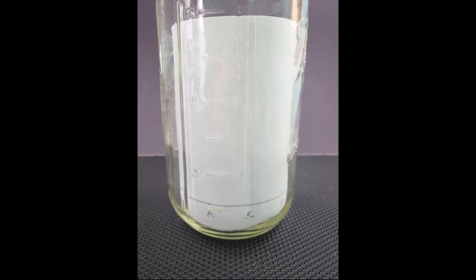Place the tube into the solvent mixture in the chromatography jar. Make sure that your pencil line is just above the solvent surface and securely place the lid on the jar. Leave the jar undisturbed for at least 30 minutes.